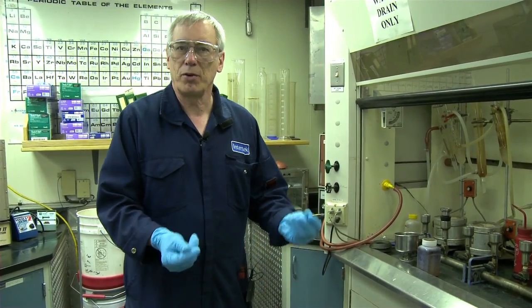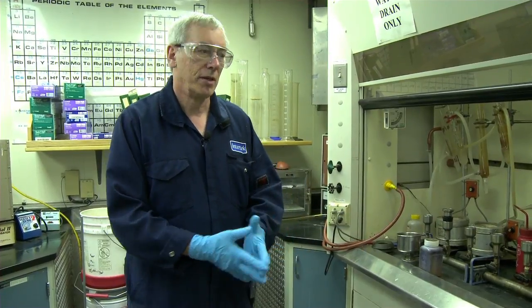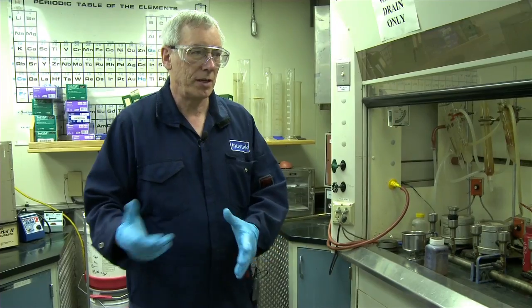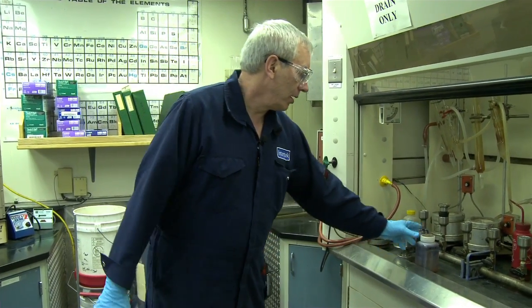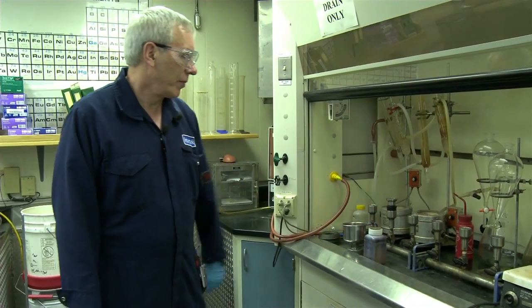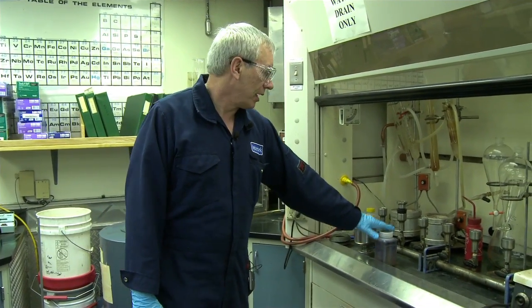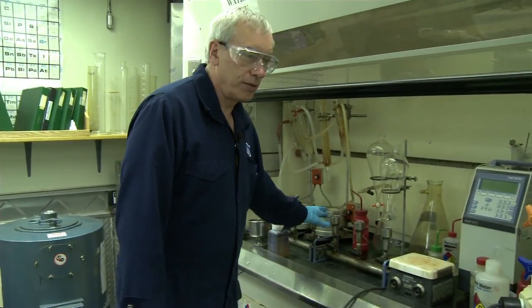and then there's a lot of little grit and sand that comes up from the wells, and they want to try to optimize their facility to see where the problems are. So that's what this is all about here. It's filtration.